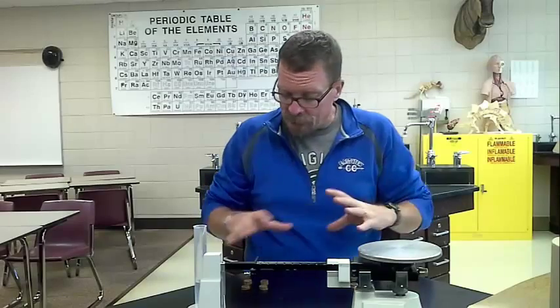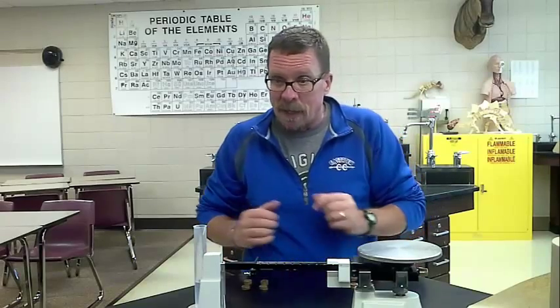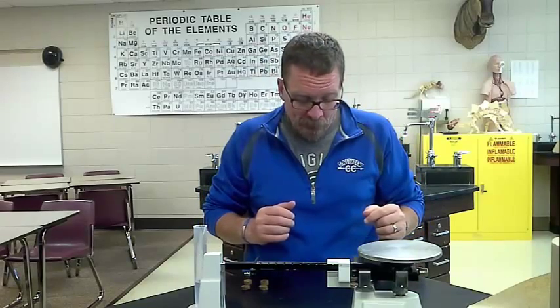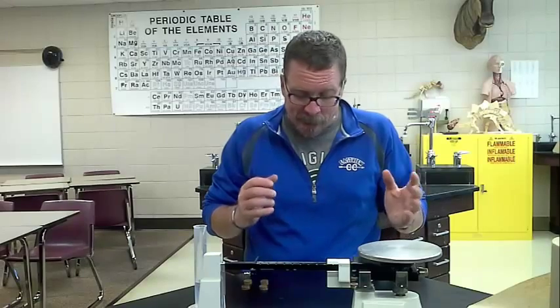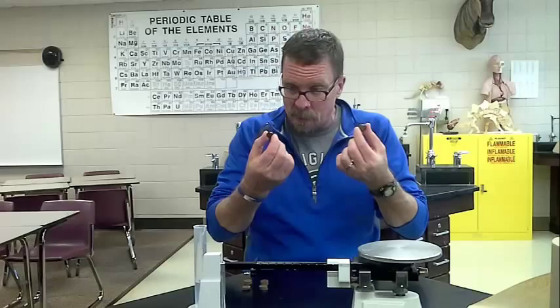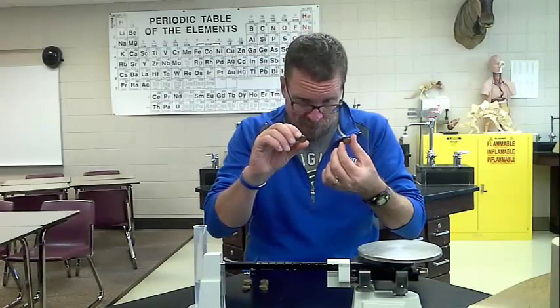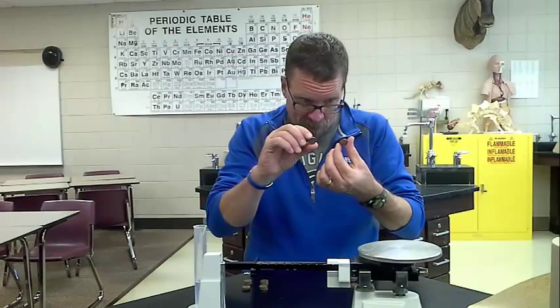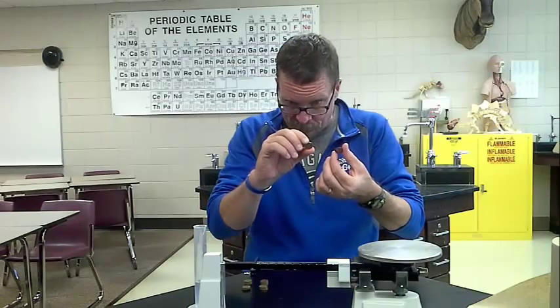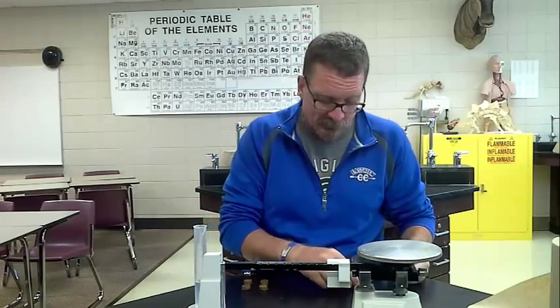So our hypothesis is we're going to see if they have changed these pennies at all in any time periods. They both look the same. They both are brown color. They both have Abe Lincoln. They both have the same words and a date stamped, and the front and the back look the same. The question is, are they the same?